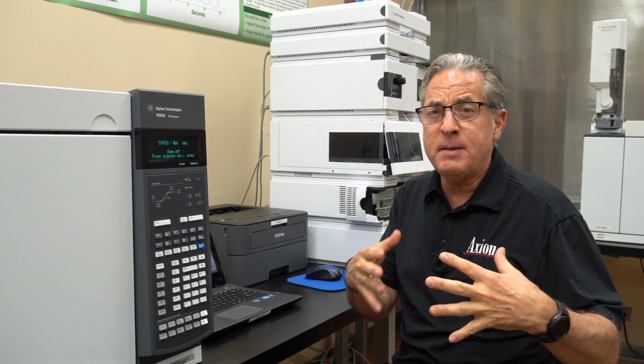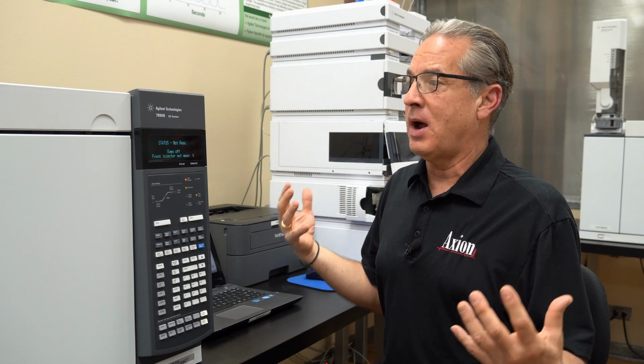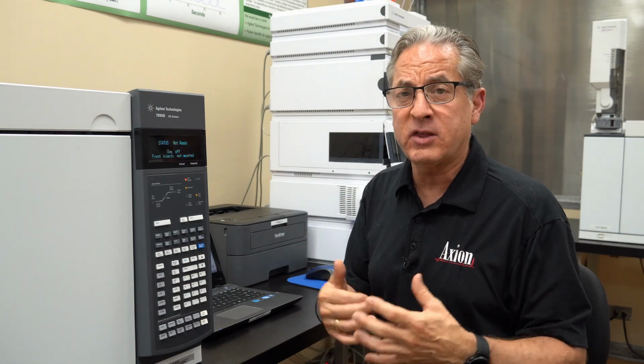So let me back up a minute. Make sure you check out that video if you haven't. Let me back up a minute and get you to understand that when we're troubleshooting, we're not really sure what the problem is, so we want to sort of eliminate parts of the instrument. An example is we could take off the autosampler tower, make an injection without the autosampler.